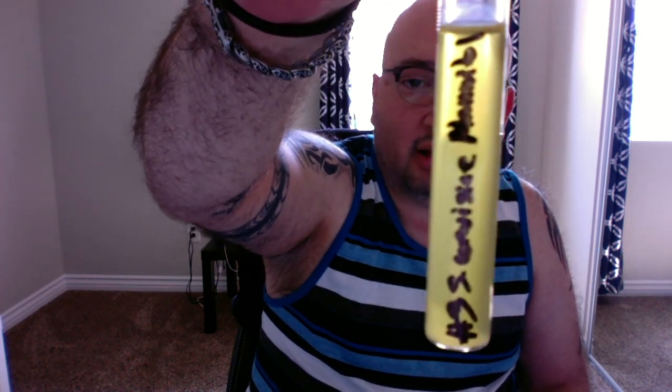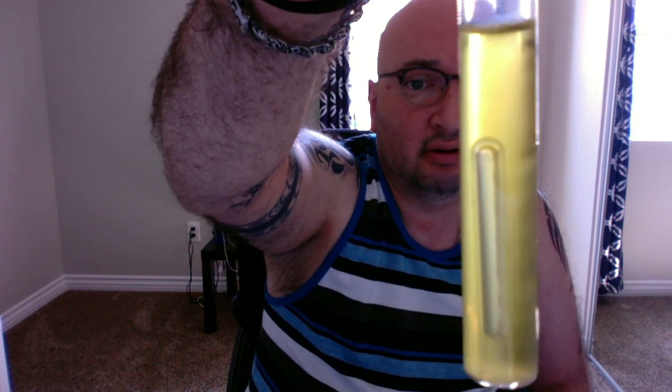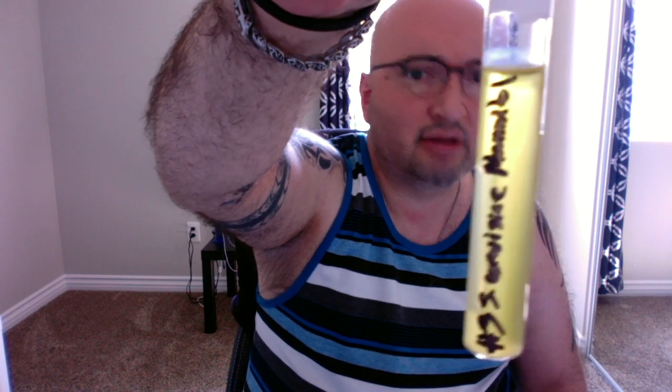Right? And then lastly, we're going to look at the S. cerevisiae with mannitol. And again, we have the yellow color, so this definitely did ferment. It is acidic. The Durham tube is there. And not many clear bubbles in here, but you can definitely see a nice layer there. And there's foam up on top. So the S. cerevisiae with mannitol did ferment. There is some minor gas production.